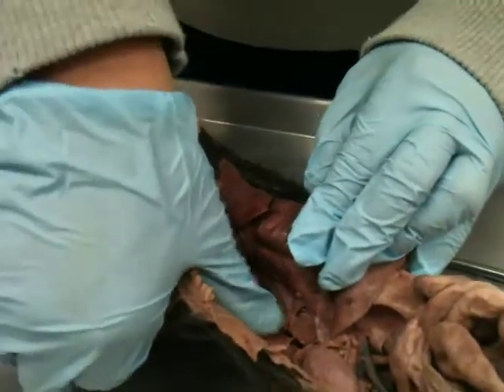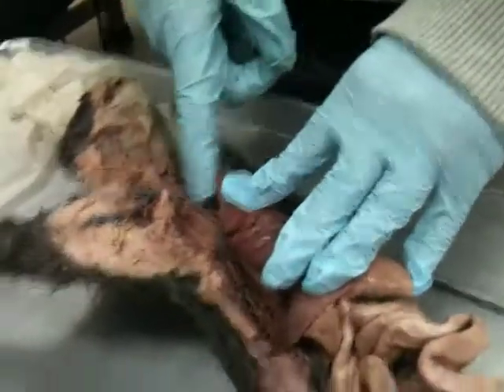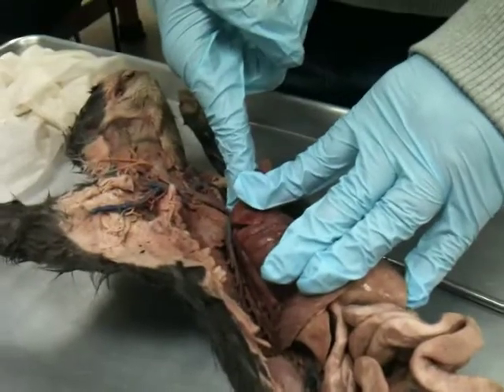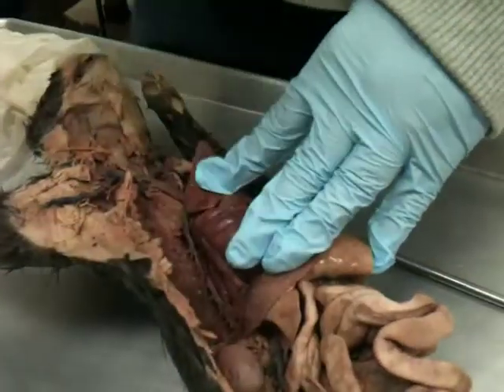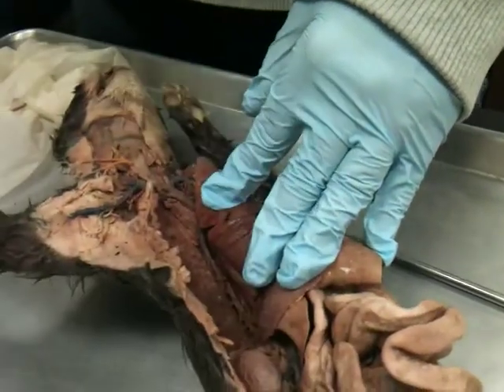And that's running to connect with the superior vena cava? Yeah, so it runs all the way down and it sort of drains back into that inferior. It's branching off of the superior vena cava, right? And then it comes down and it's sort of going to be connecting with that inferior vena cava down here.